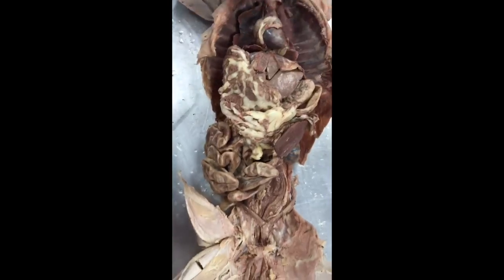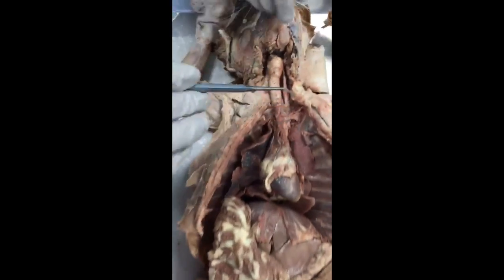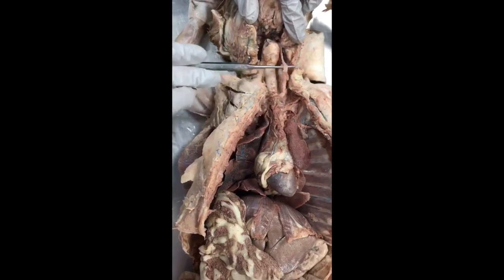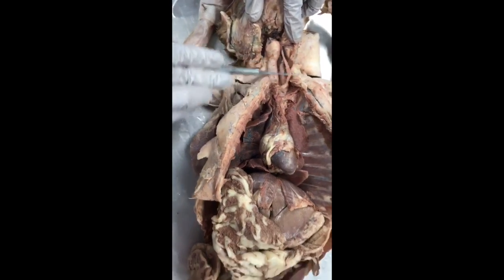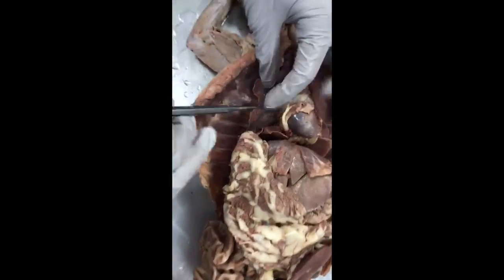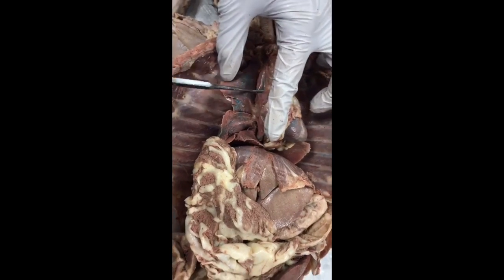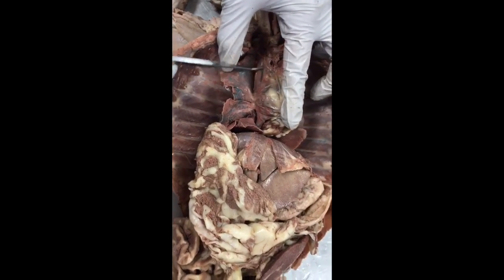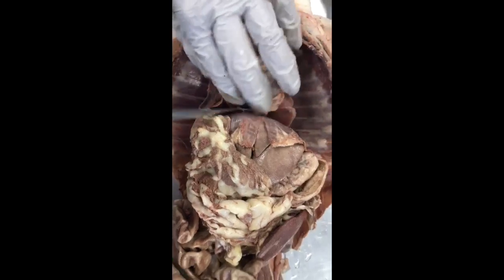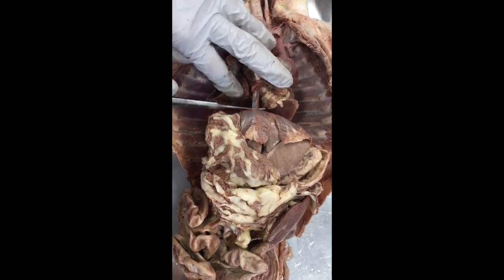On ours, you can't see the jugular vein, but it would be up here running against the common carotid artery. And then we have the superior vena cava, which can be seen right up here. And then the inferior vena cava is right in here.